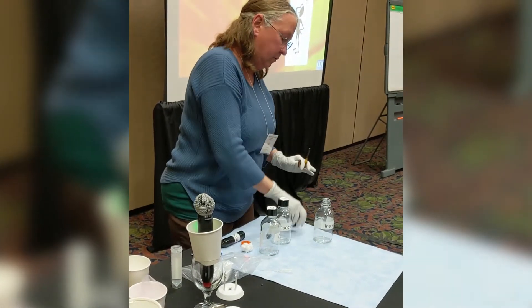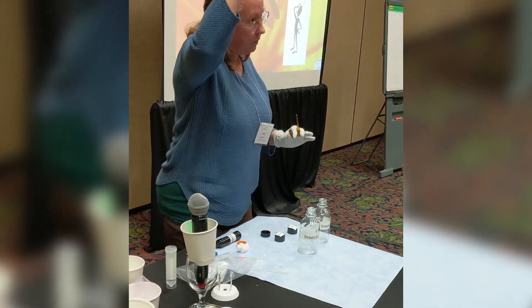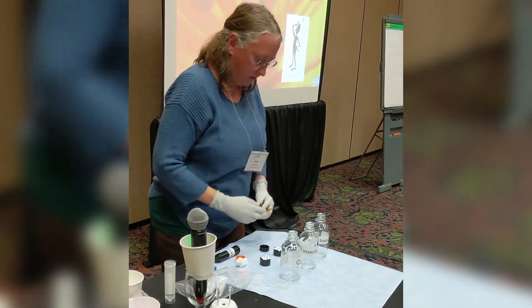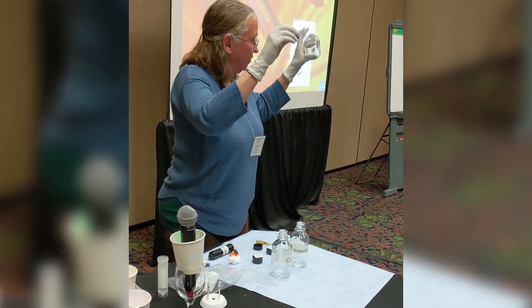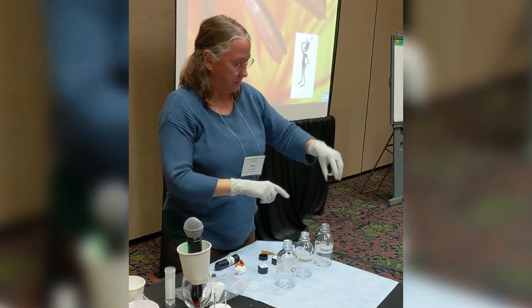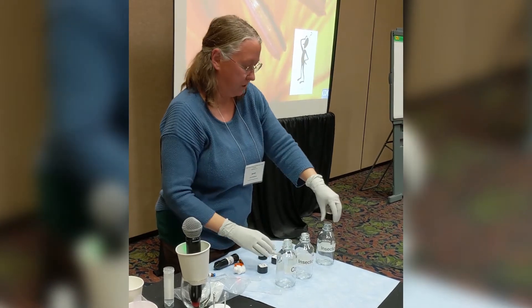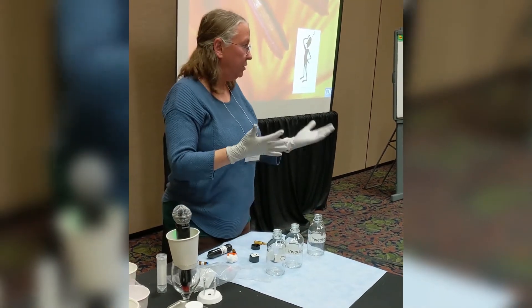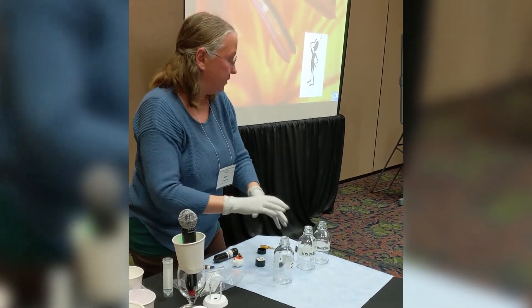The very first thing you do is label your bottles. You want to have a control which will get just acetone, and then you have your bottles with insecticide. It's very important when you label your bottles to label the top and the bottle together so you know this is one unit — you don't want to mix tops between bottles later. You'll usually make about four bottles with insecticide to one bottle of just acetone.